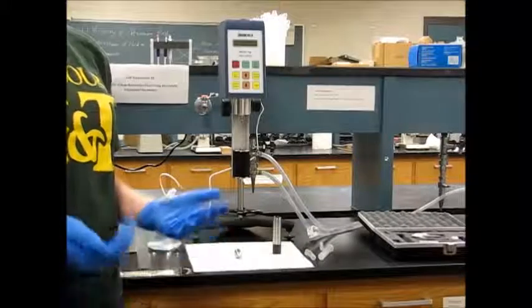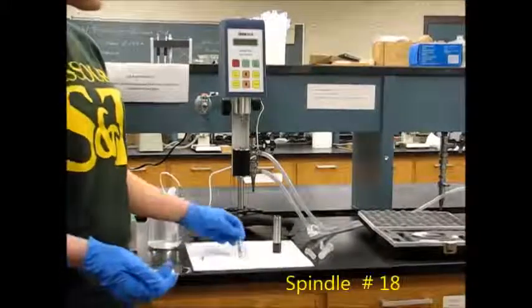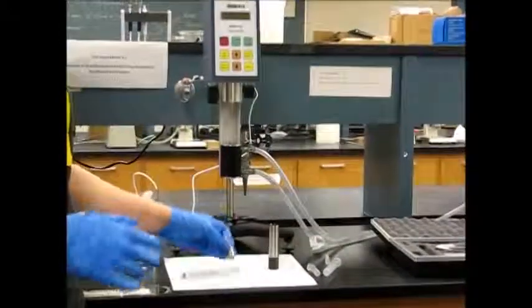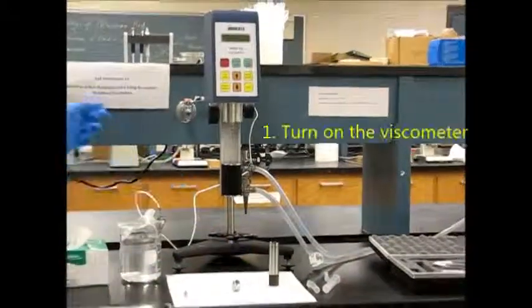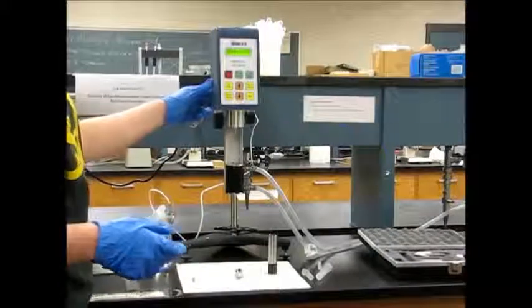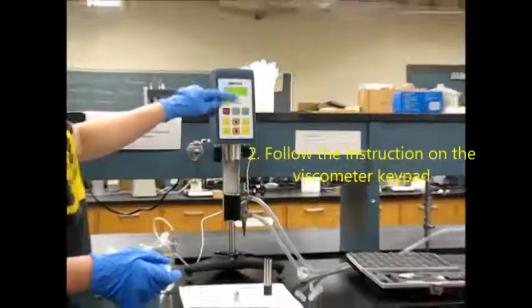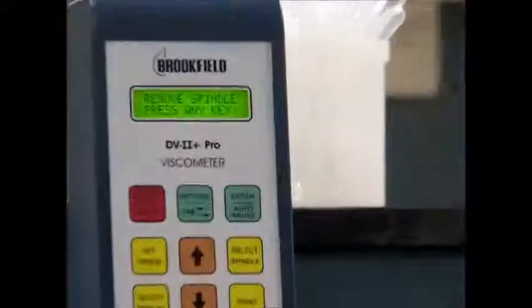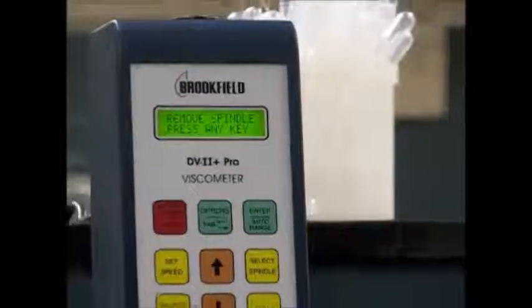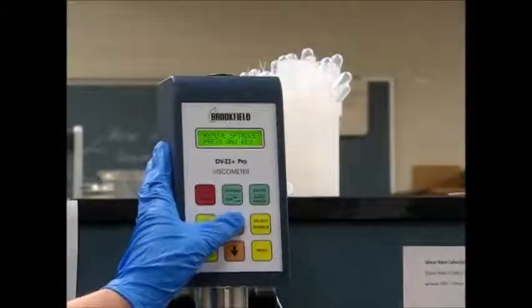So for the purposes of this experiment, we're going to use spindle number 18. It has an 18 on its stem. The first thing that we're going to do is turn on the viscometer with an on-off switch on the back of it, and we're going to follow the directions on this keypad. It tells us to remove the spindle. We don't have a spindle attached, and then it says press any key. So I'm going to go ahead and press a key.